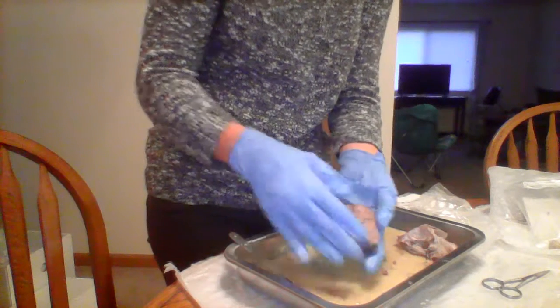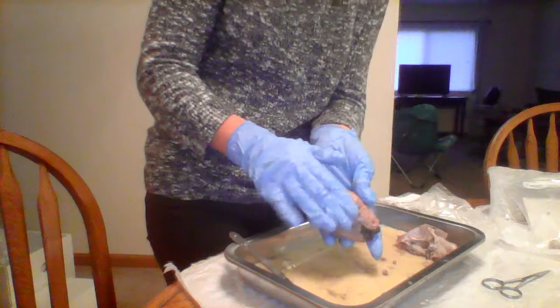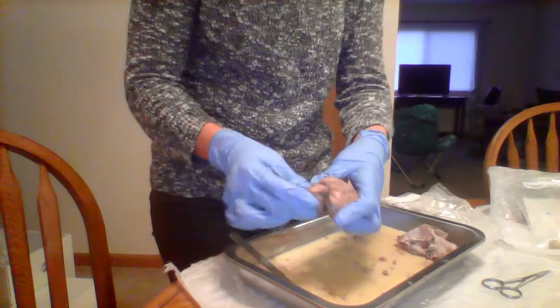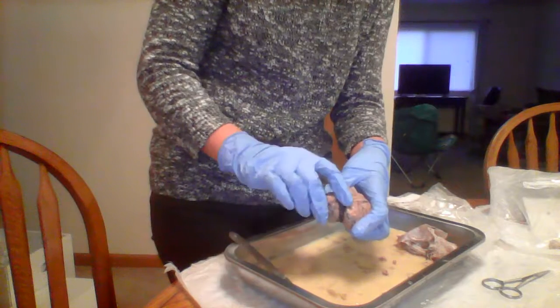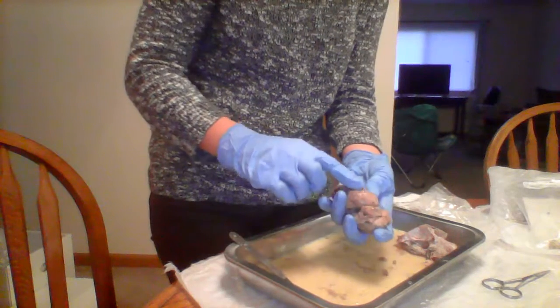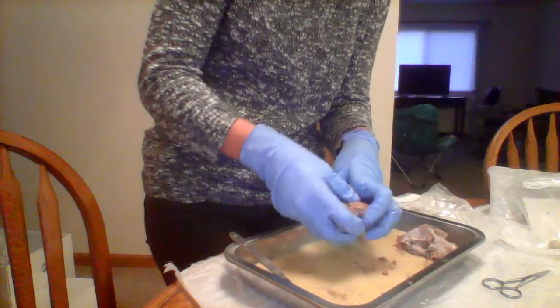The parietal lobe is like the middle of the brain, it's on top. The occipital is in the back of the brain, just above the cerebellum. The temporal lobe is on the sides. On a human, it's like above the ears.